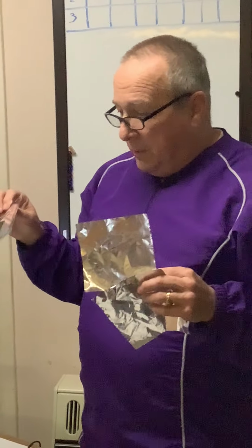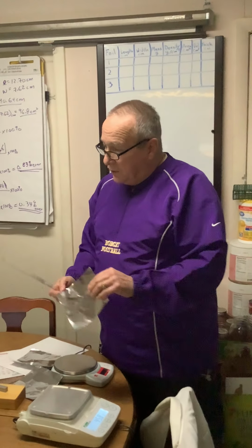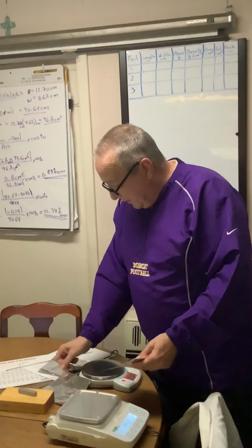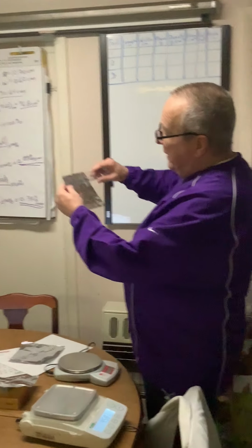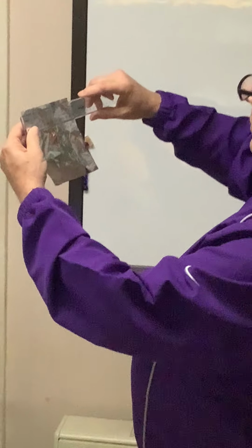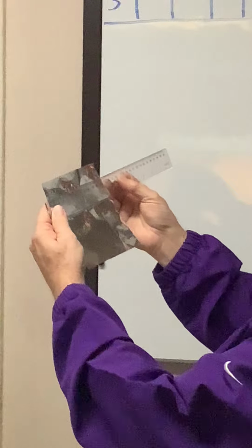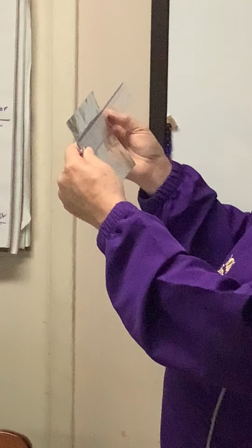It asks for them to be 10 centimeters or longer. And it says, using a centimeter ruler, carefully measure the length and width of each piece. So, for example, piece number 1, when I measure it, its width is, wrong side of the ruler, 12.6 centimeters, and its length is 14. And what we want to do is measure the thickness. That wouldn't be practical using this measuring instrument.